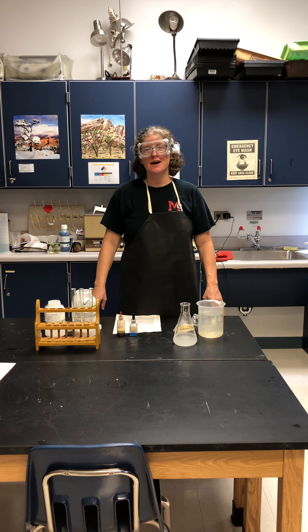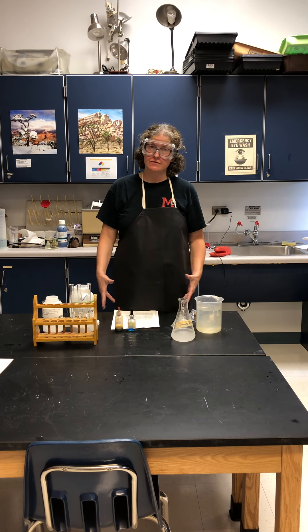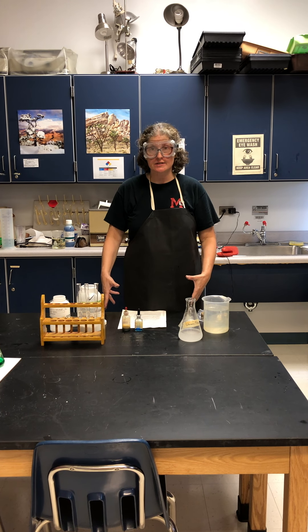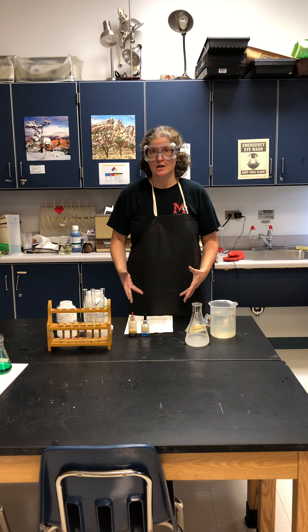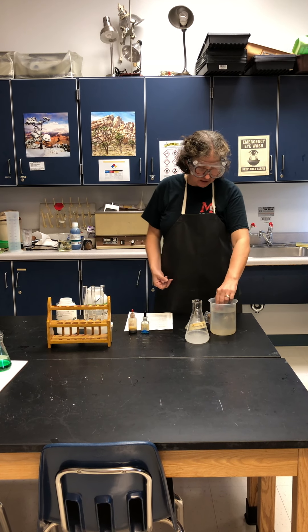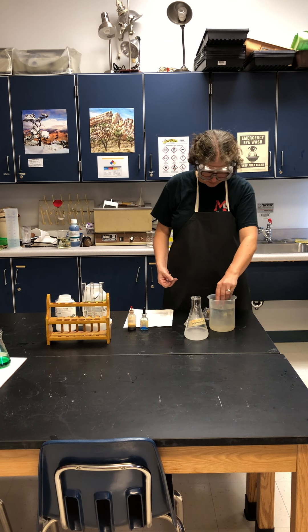Hello, this is Mrs. Murdoch, and this is part one of the osmosis and diffusion lab that is part of your AP lab list. I'm going to demonstrate a qualitative study where we're going to analyze substances that are moving in and out of something called dialysis tubing.